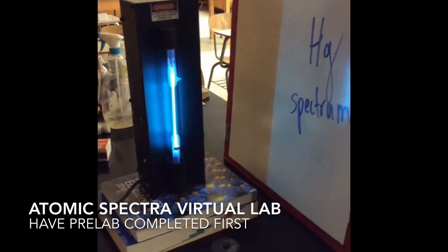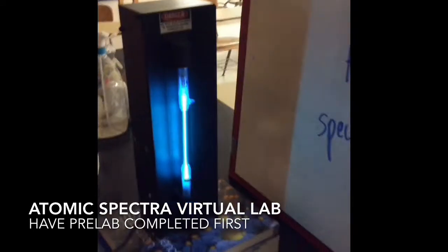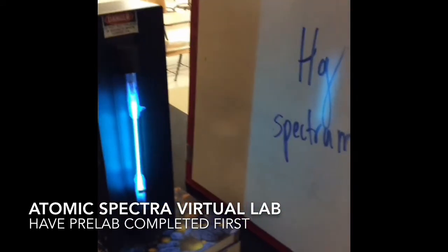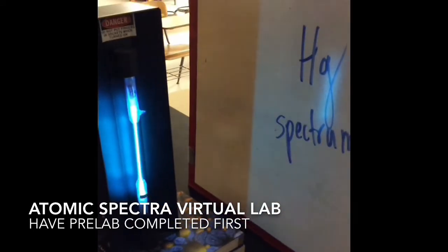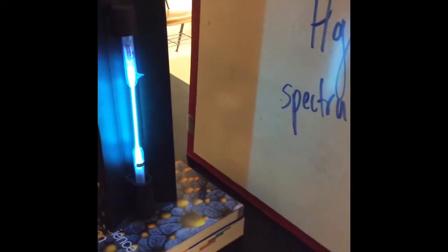Okay, this is the second part to this electron lab. The first time we took metals and we put them in flames, and you could see that they each produce their own specific color. But it was kind of hard to tell if you had a mixture of colors. It's really hard to define the specificity of all the electron arrangements in something like that.